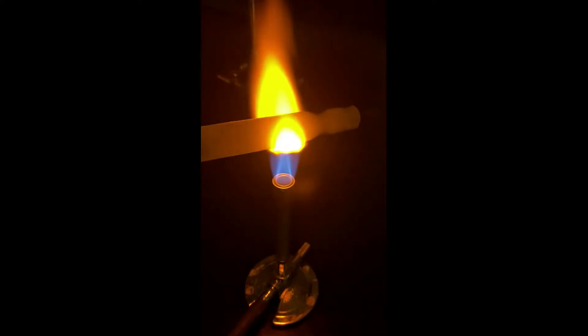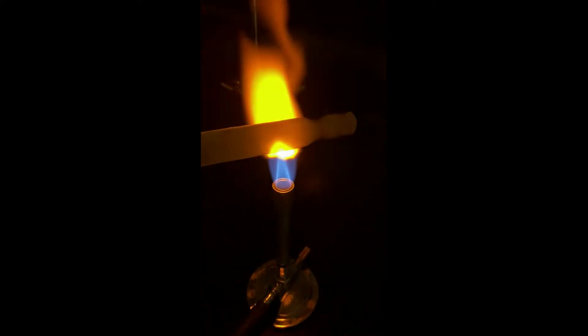And then put it directly over the flame. Not too close to where the gas is actually coming out. Put it at the upper part of the flame.